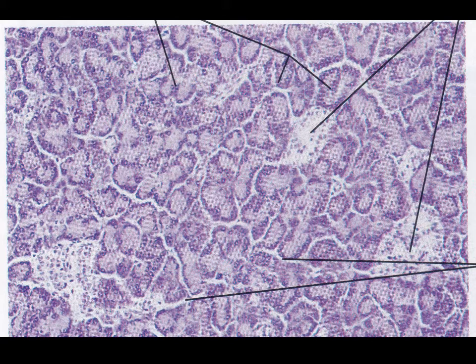Next up, we have the pancreas. And so here we have the pancreas, and you'll remember that the pancreas is almost entirely exocrine in nature. So these are all exocrine cells in terms of the tissues that are here. And then we have these little kind of islands. These are the pancreatic islets or the islets of Langerhans. And so those tissues within that are going to allow us to have the production of our endocrine side. So the endocrine is kind of few and far between as far as the tissues go.